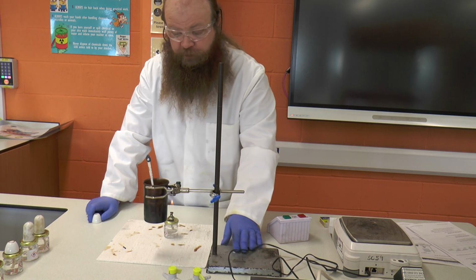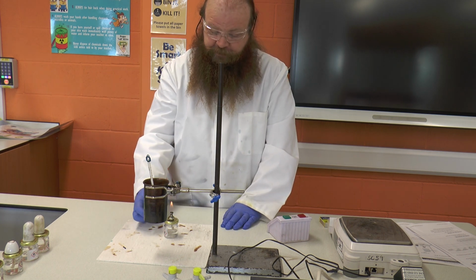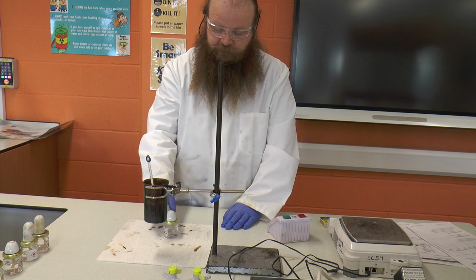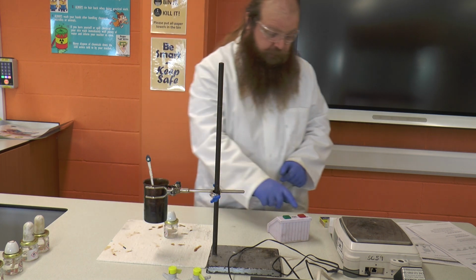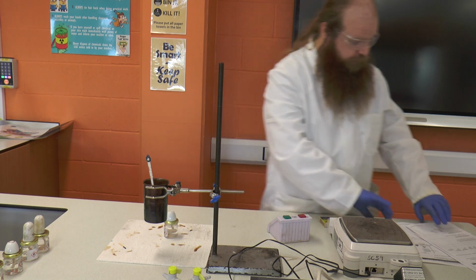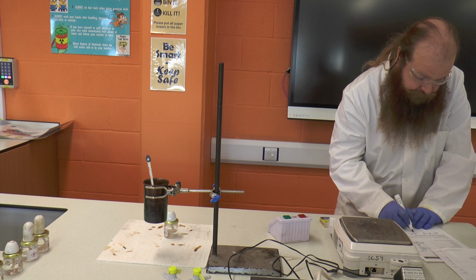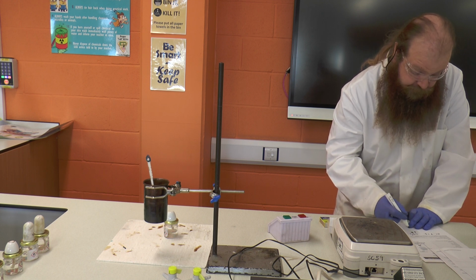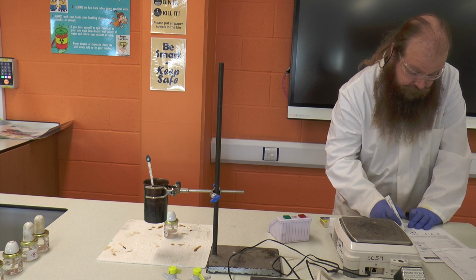Okay, so now we can move our can out of the way. We can use our cap. We just very carefully from the side put our cap over the top of the flame and put it down. We're going to leave it all to cool for a moment. Okay, we're going to record what our temperature change was. So we started at 23, we finished at 67. Okay, so that means we have a change of 44.